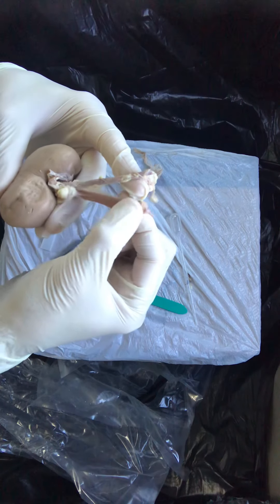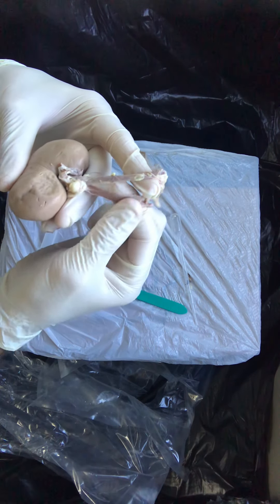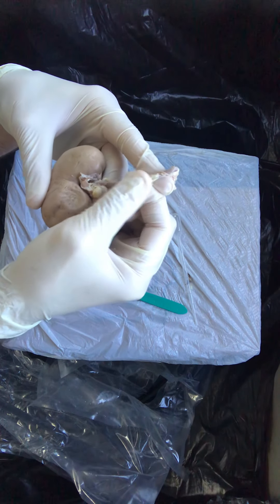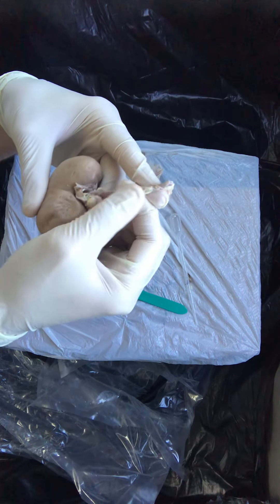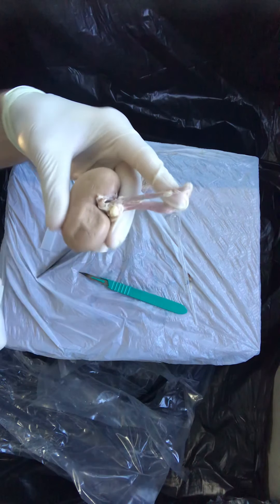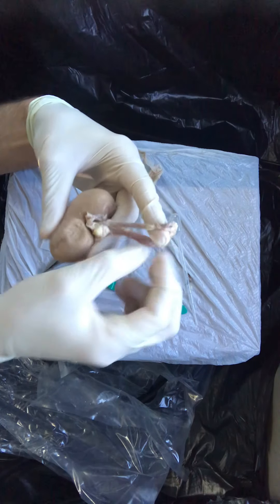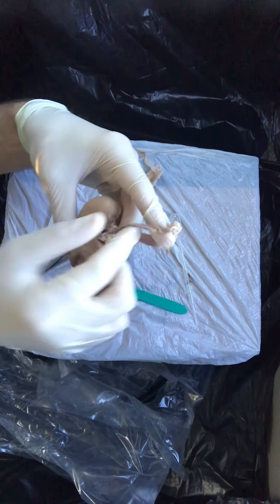The vein is more flat and wide and thin walled — you can feel it. This is the artery. It feels more like a piece almost of spaghetti before it's fully cooked. It's smaller in diameter, it's thicker walled, it's more round than oval. Those are all characteristics of an artery.